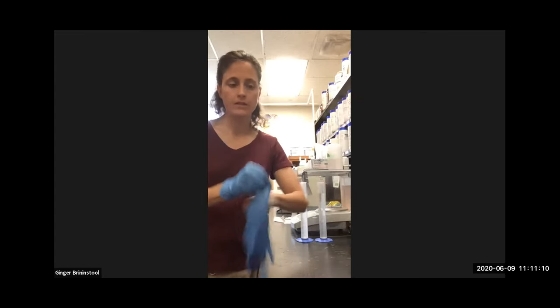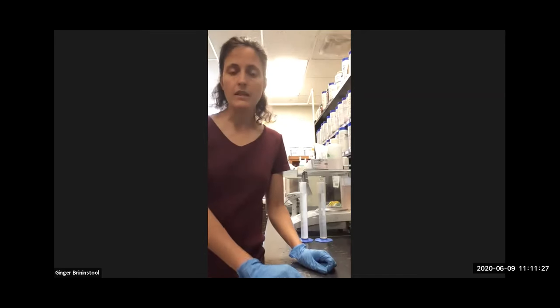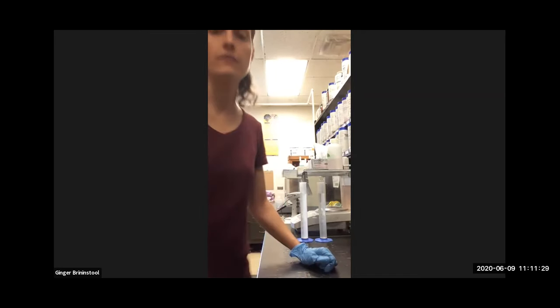Okay, so I've got my gloves on. We're gonna make pretty simple media today. I kind of like to give you a little idea of all the different kinds of media that there are in the lab. Take a look at these.